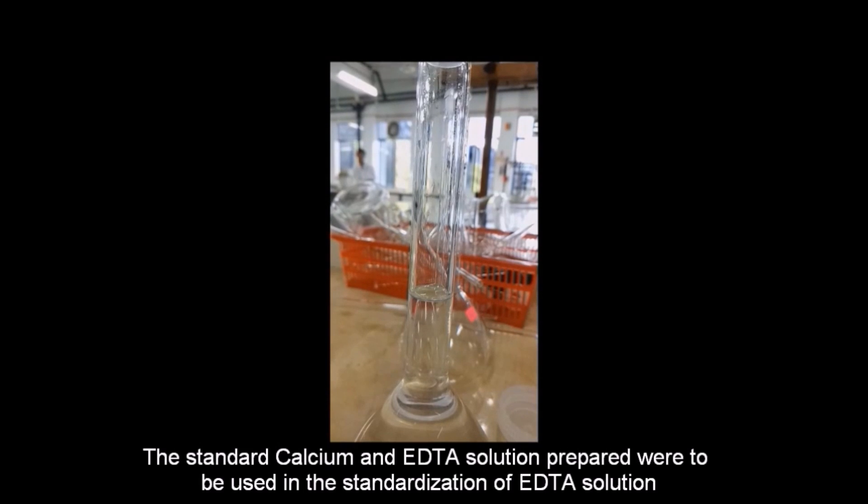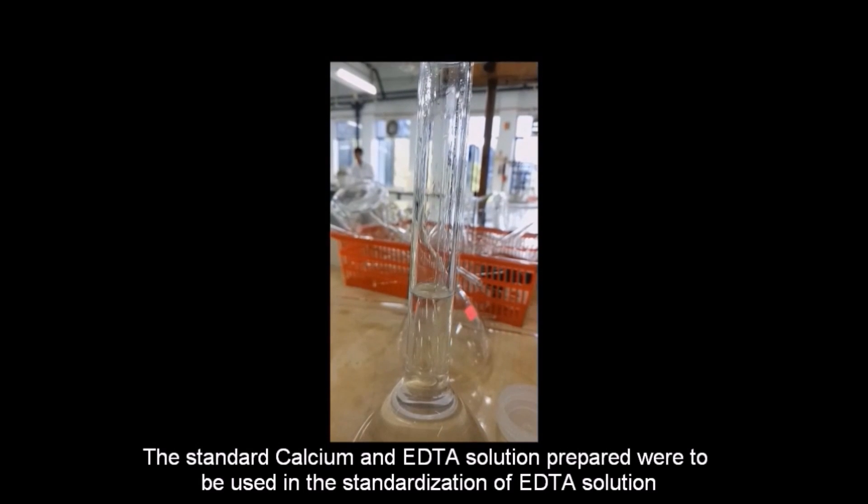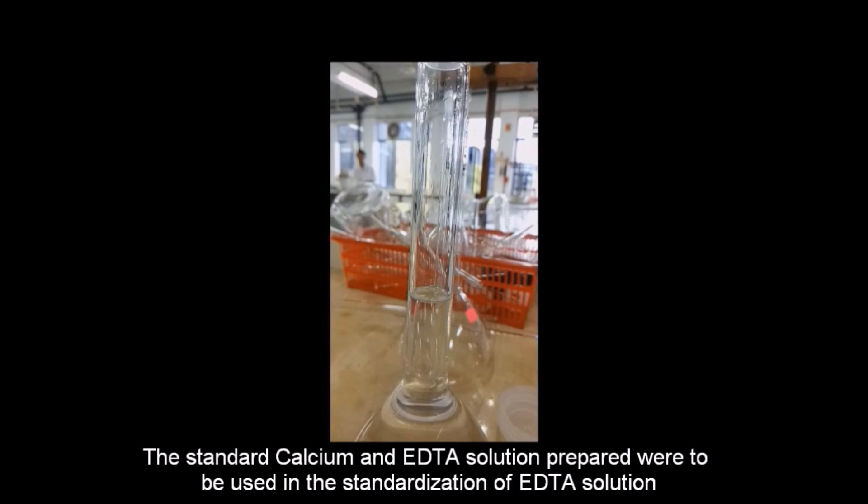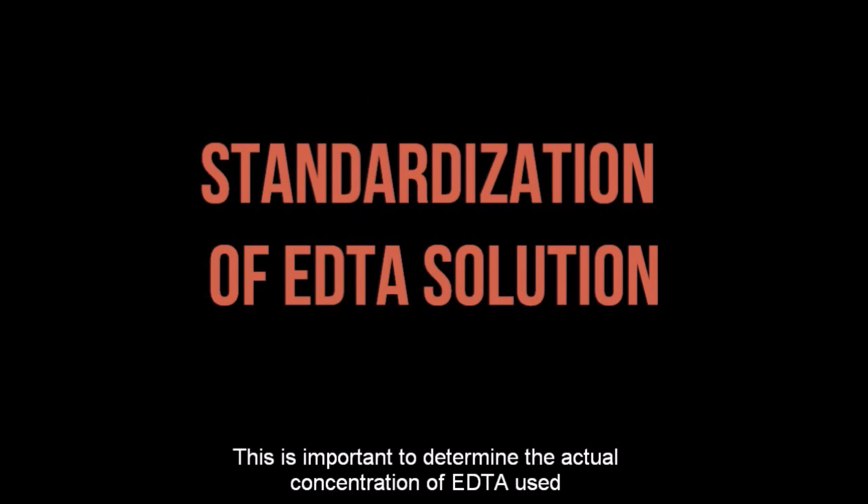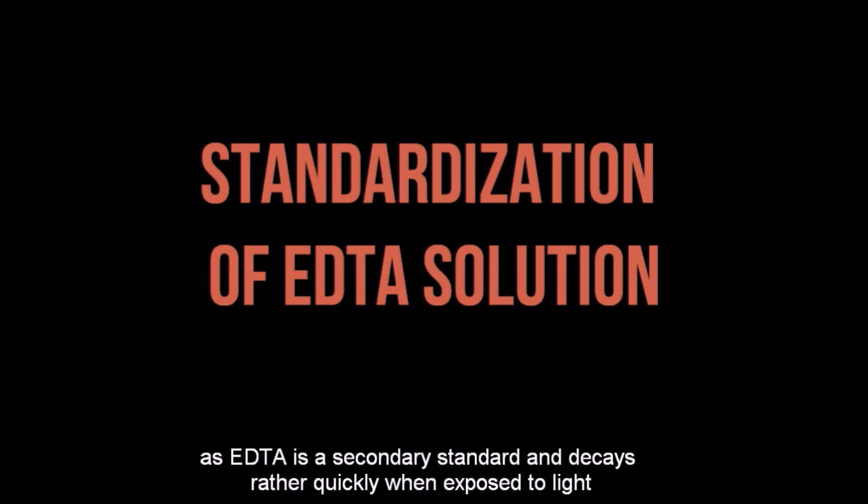The standard calcium and EDTA solution prepared were to be used in the standardization of EDTA solution. This is important to determine the actual concentration of EDTA used, as EDTA is a secondary standard and decays rather quickly when exposed to light.